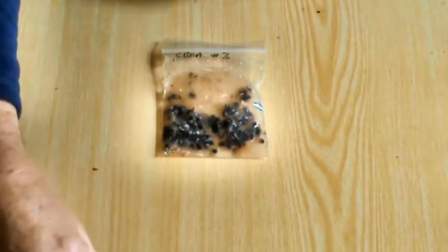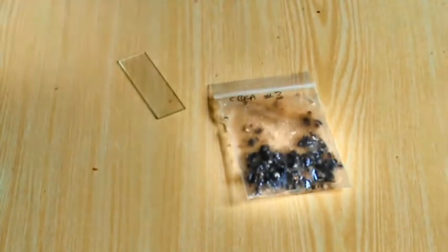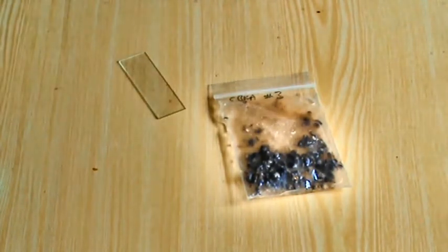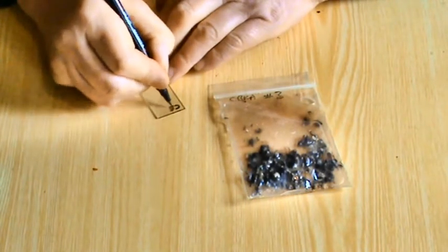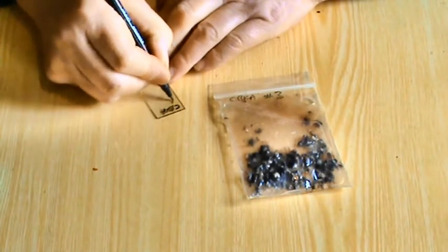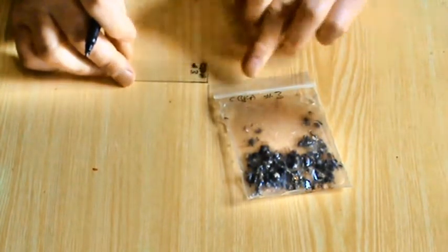So we have a microscope slide here. Difficult to see because it's plain glass. But first of all, we will write on it the identity of the hive. So we have that. So that's the same number as on the bag.